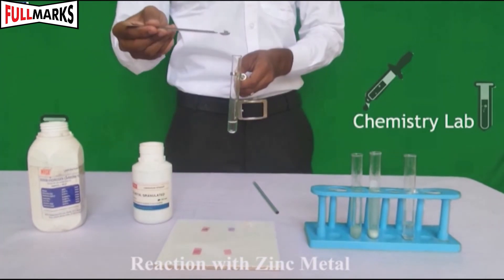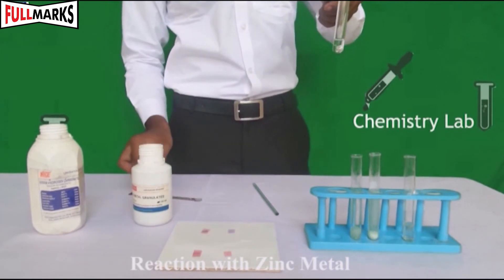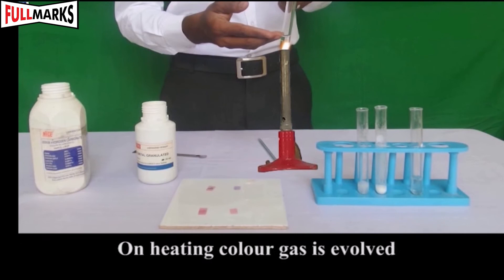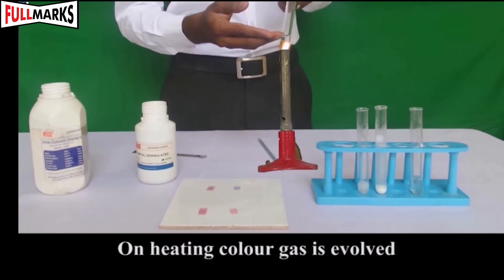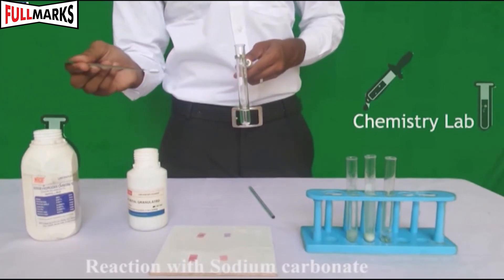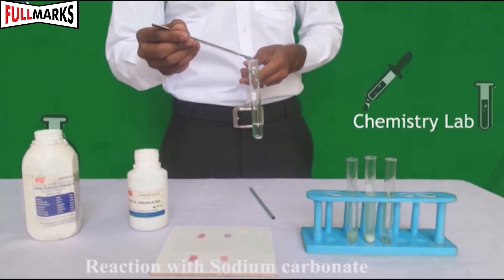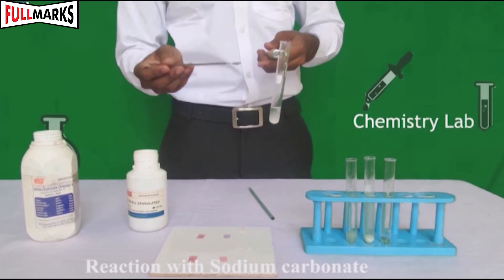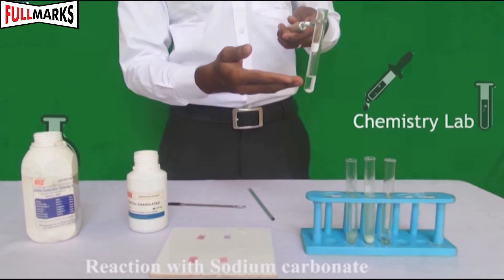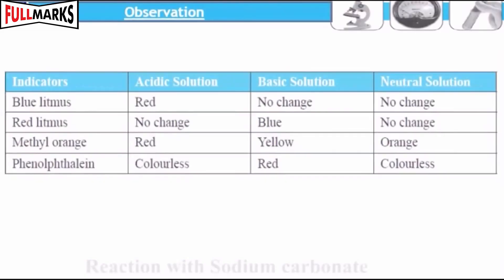On heating the mixture, the reaction begins and a colorless gas is evolved. Take 2 mL of NaOH solution and add 1 gram of sodium carbonate — no change is observed.